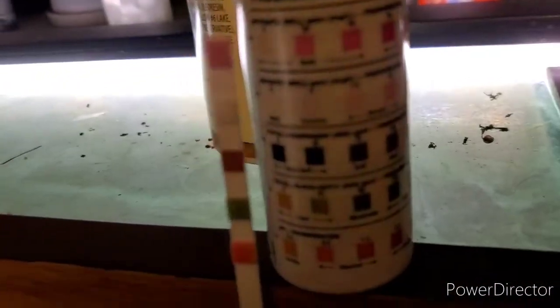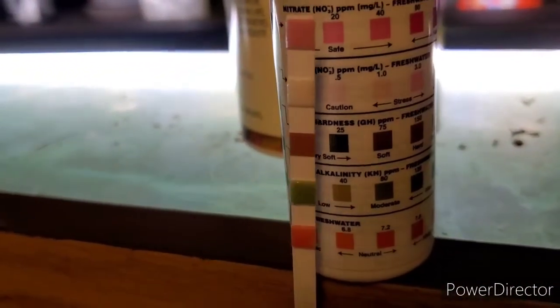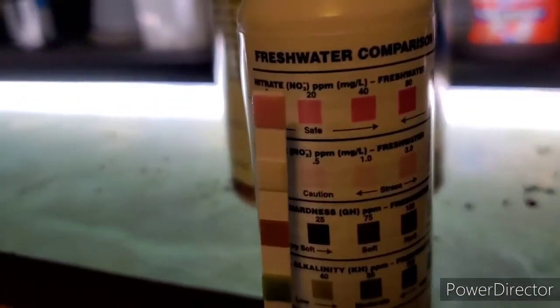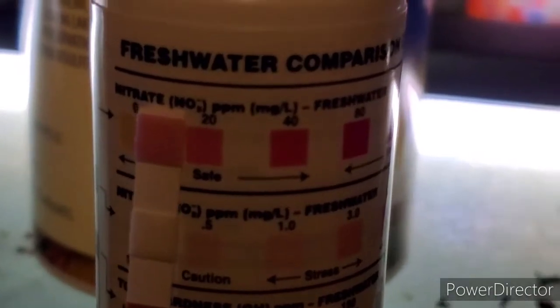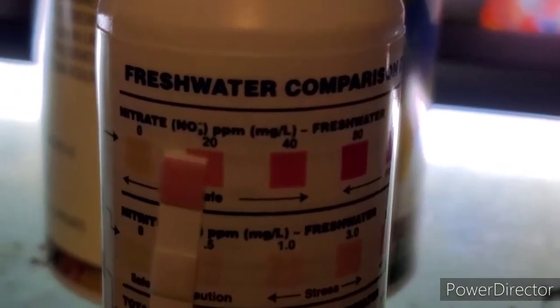Alright, so now we will compare. So, it looks like I have about, if it will focus, alright, well it's not going to focus, but it looks like I have a little bit less than 20 parts per million nitrate.